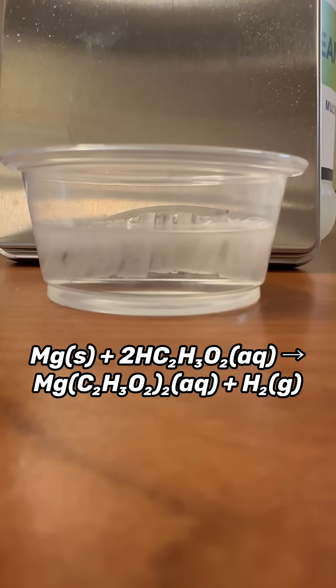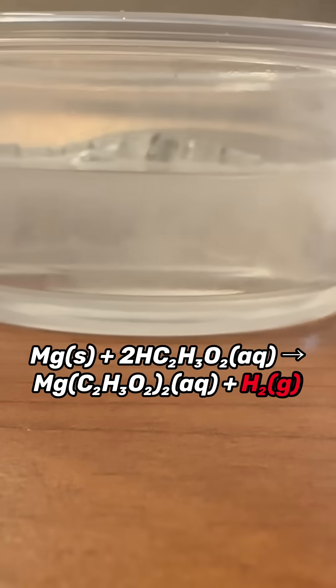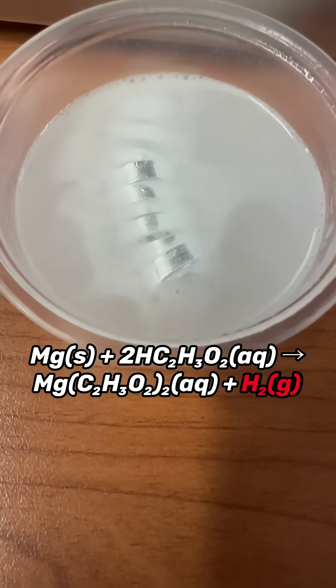The products of the reaction are dissolved magnesium acetate and hydrogen gas. You can clearly see hydrogen gas bubbles being formed.